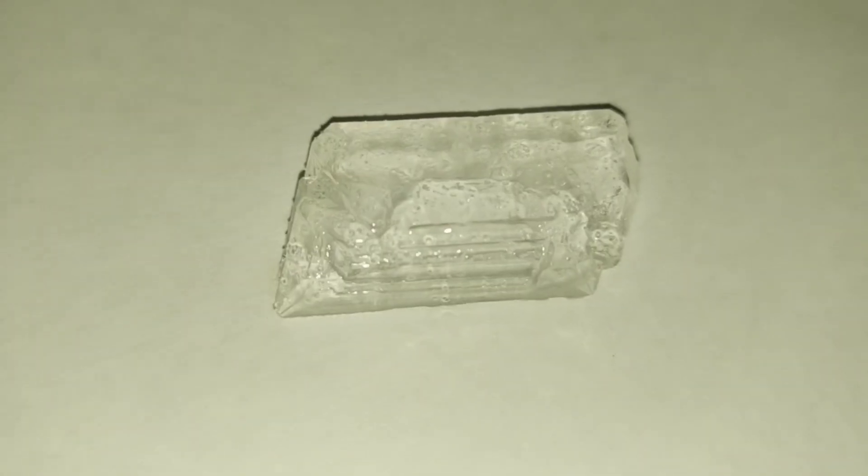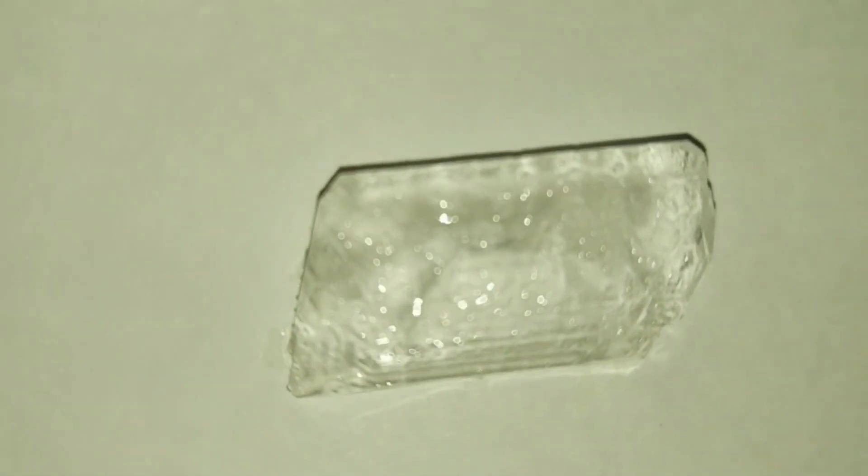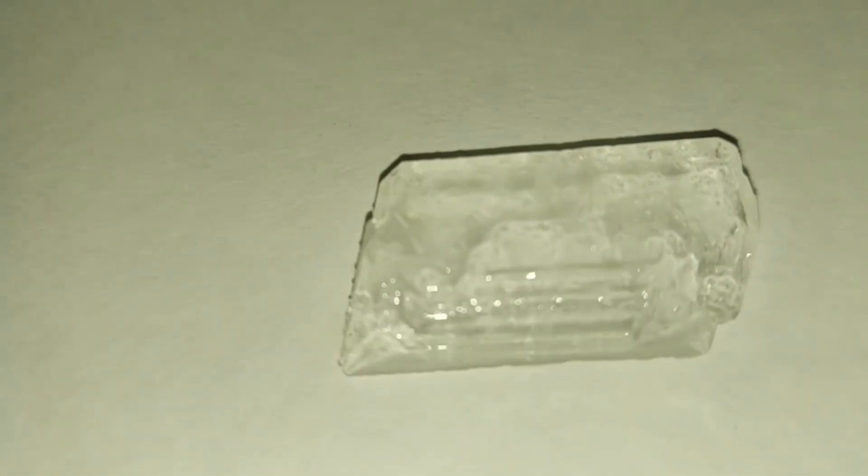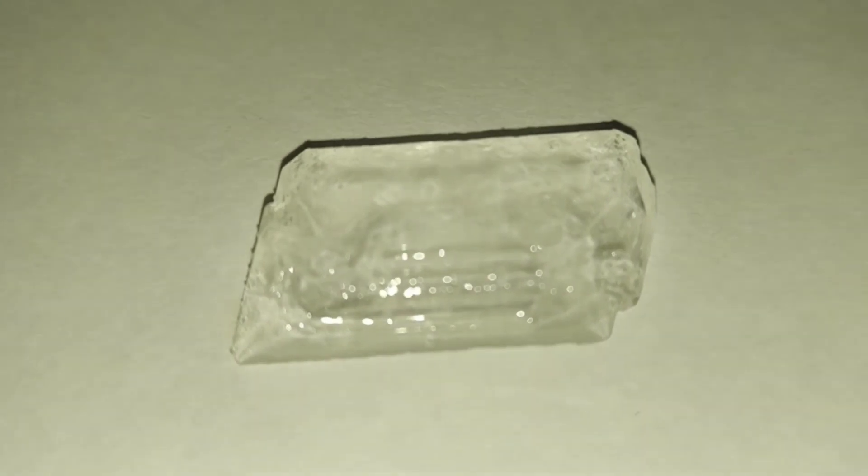I had to show you this. Here's one last example that was inside of the sulfuric acid. They're pretty amazing stuff.